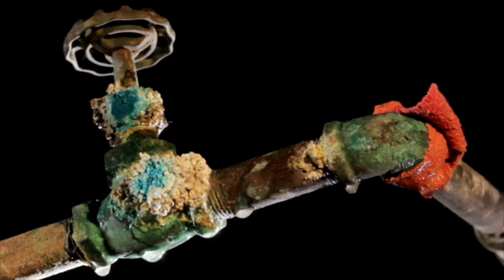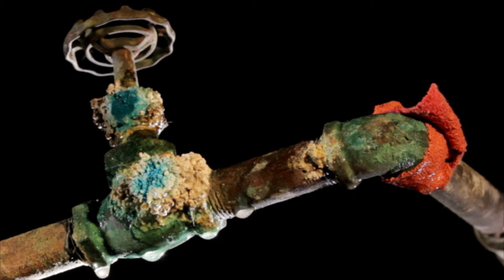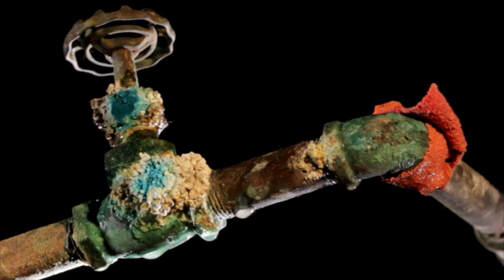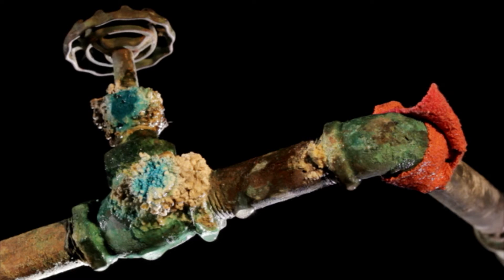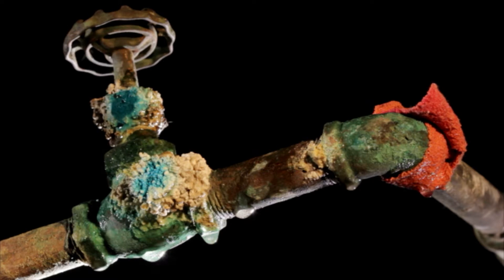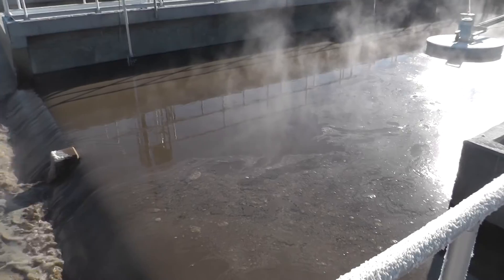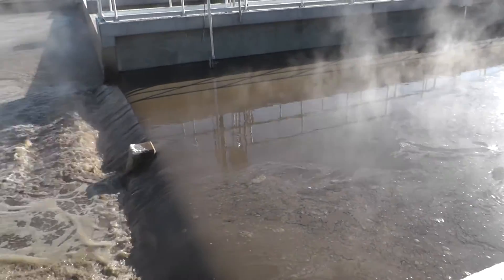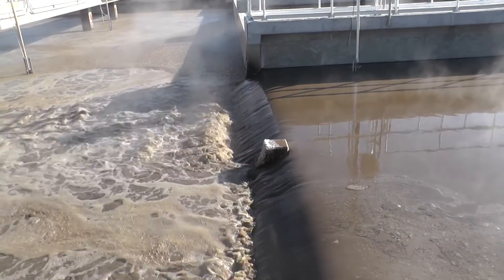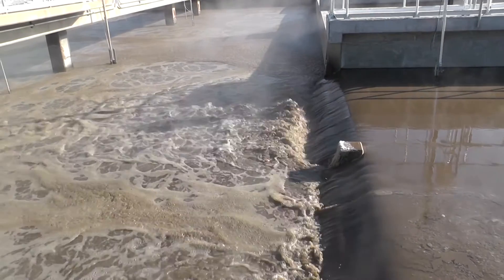Alkalinity is a measure of the capacity of water to neutralize acids in the water, which is important to maintain a balanced pH in drinking water and to maintain a balanced pH during the nitrification and denitrification stages in a wastewater treatment facility.